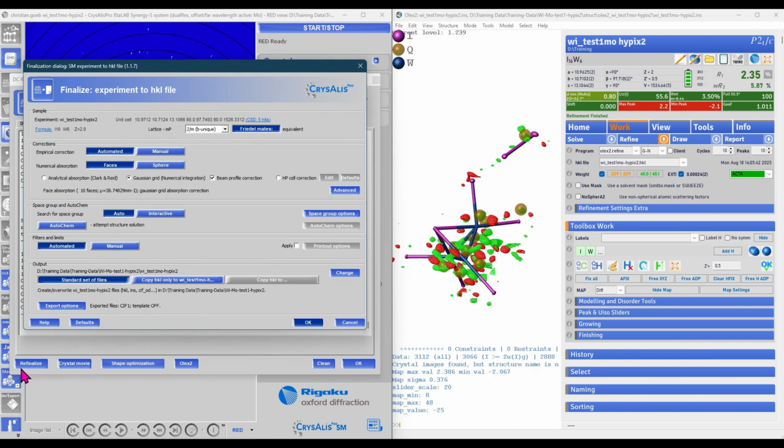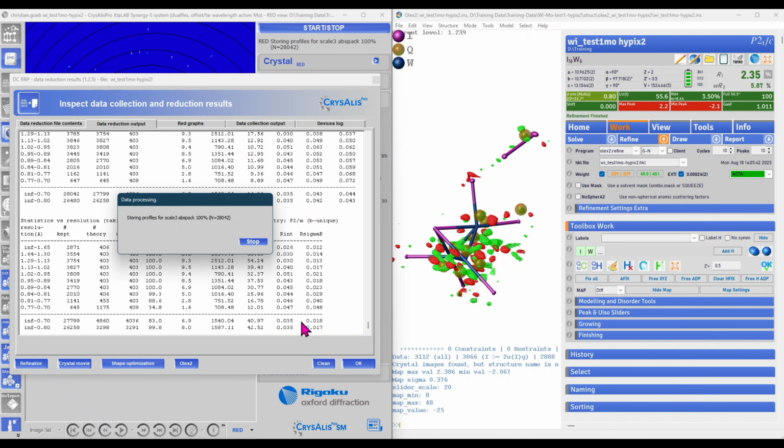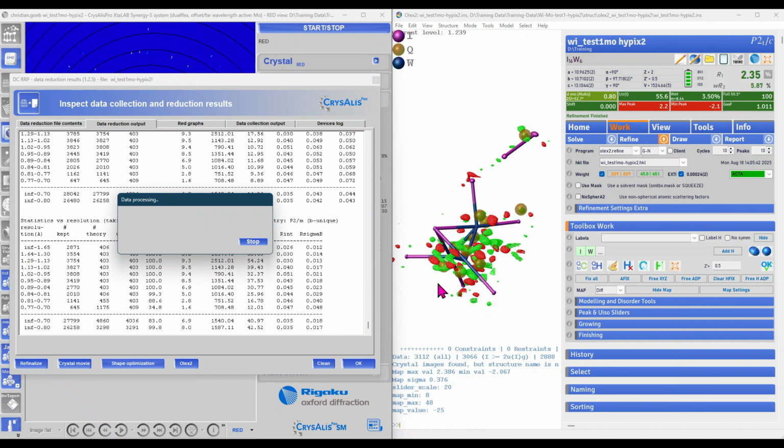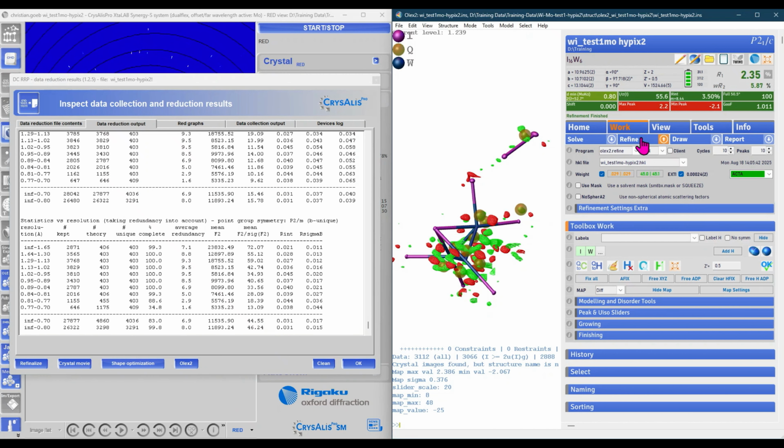If we go now on Refinalize, on top of the empirical absorption correction, we are doing now also numerical absorption correction. Choosing the second option here, copy HKL, will also copy the newly scaled HKL file into our structure refinement folder. All parameters have improved, may it be I over sigma or R int.